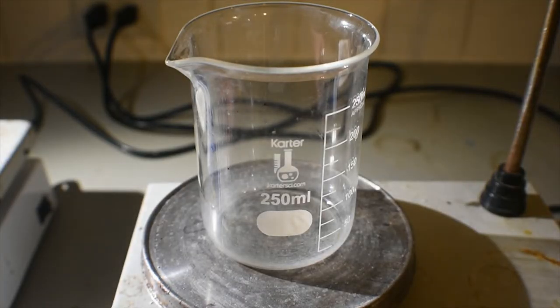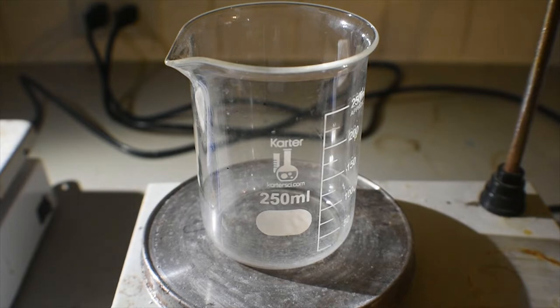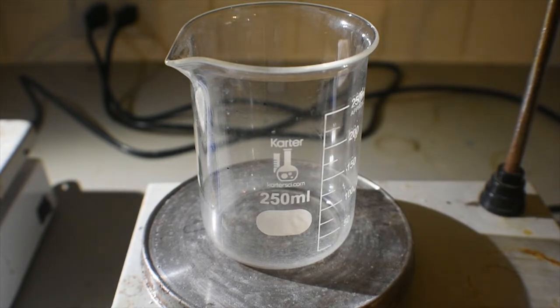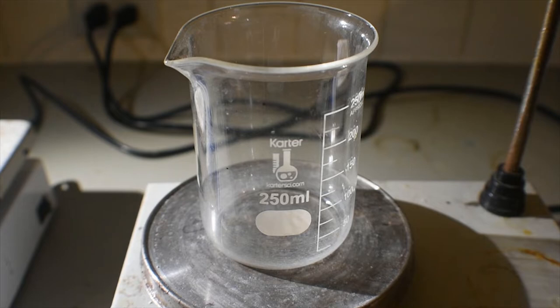So what I'm going to do now is add the oxalic acid and oxalate to the beaker. Then I'm going to add a small amount of ice, and then I'm going to add the permanganate. Then I'm going to add more ice. It's a pretty tricky reaction, and sort of a weird one, but this is just how you have to go about it.